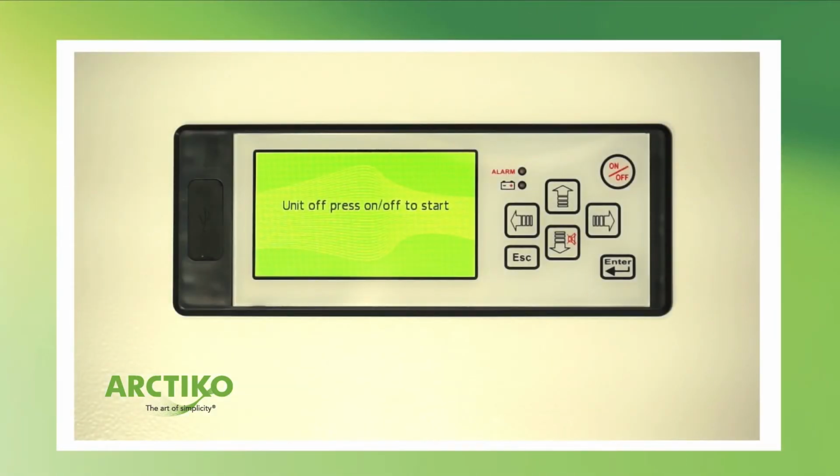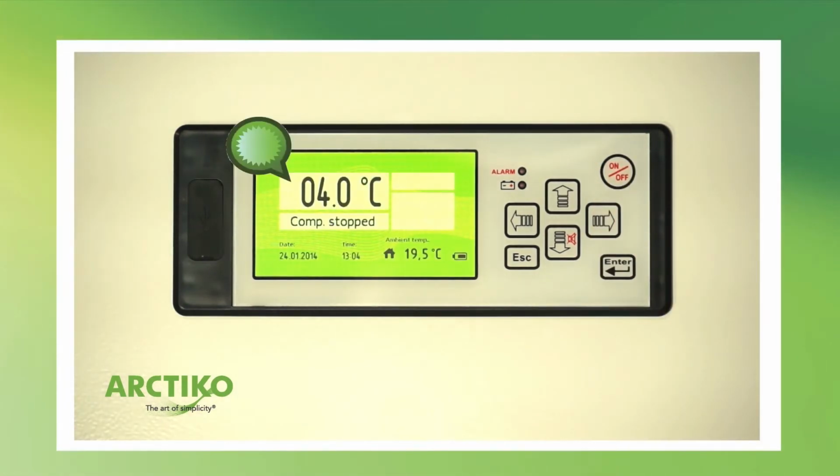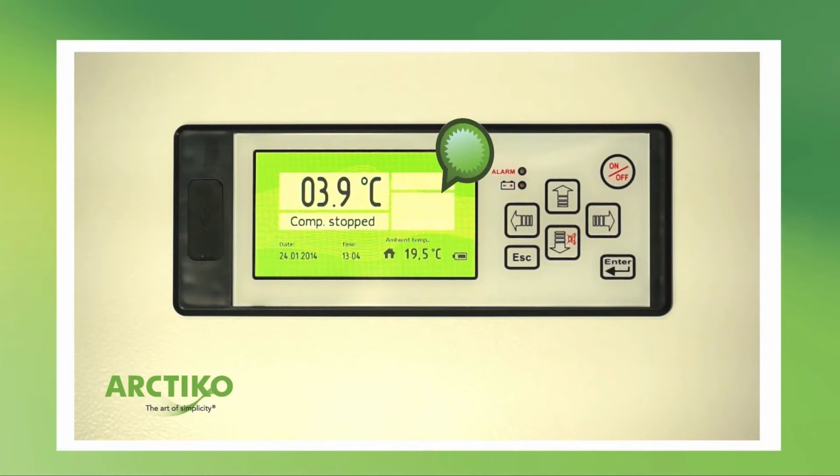Press the on-off button to start the controller. Here's the current temperature inside the unit. You can choose between comma or decimal in advanced settings. Here the current alarm icons will be shown. If there's more than one alarm, they switch between the current alarms.